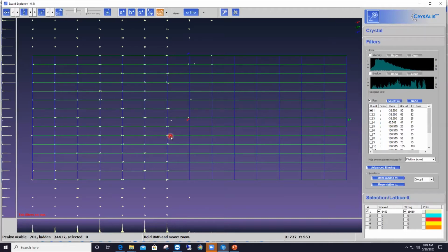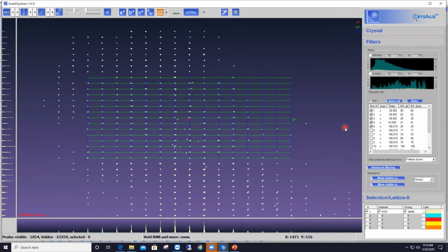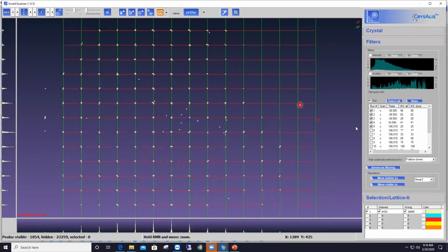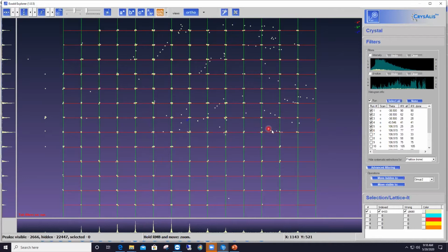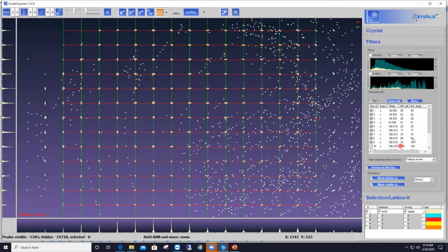There's no sign of icing at all. Same goes for scan number 2 and 3 and 4 and 5. Up to scan number 5, everything is clean, and that's true along A star, B star, and C star. If I display scan number 6, some ice features start appearing, but it's pretty light. 7 is pretty okay also. And 8, it starts getting a little bit worse. 9 a bit worse, and so on and so forth.